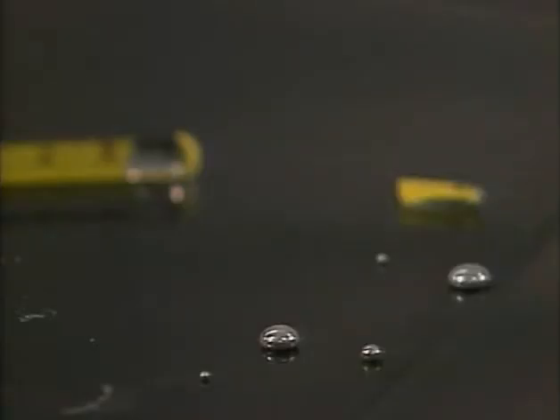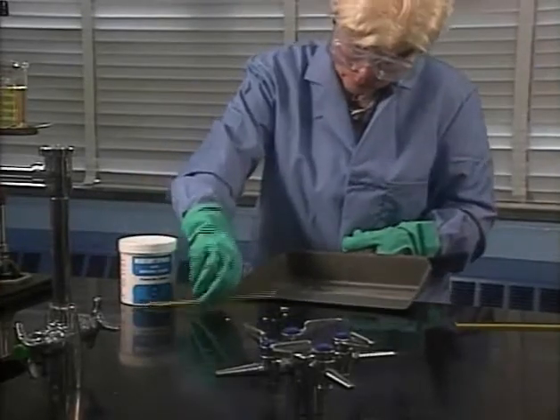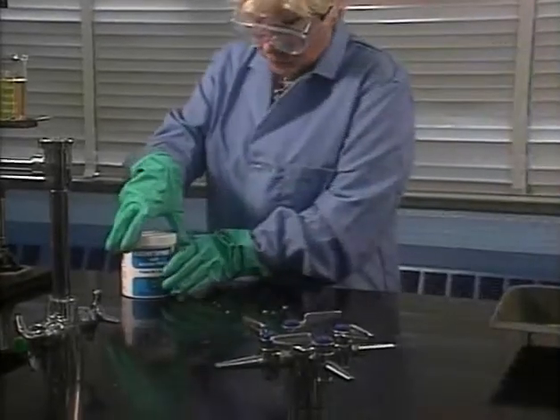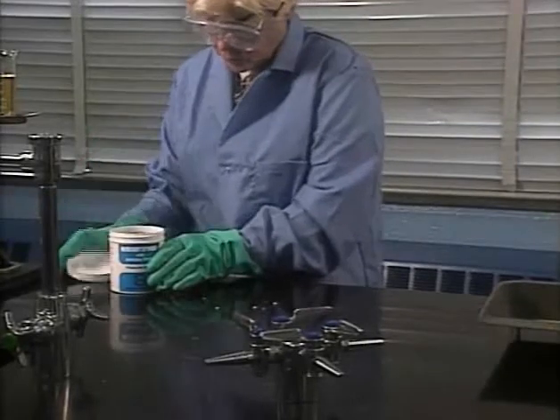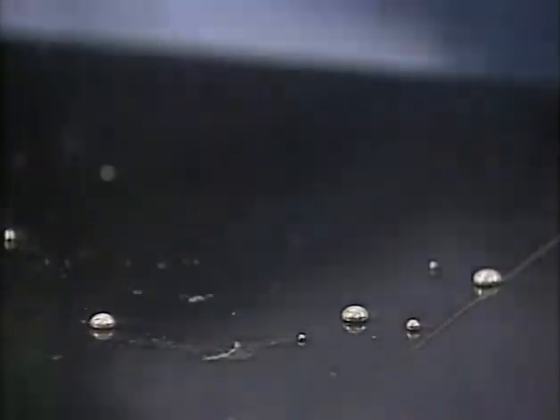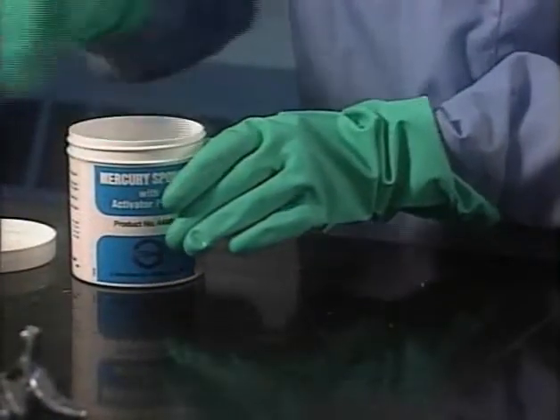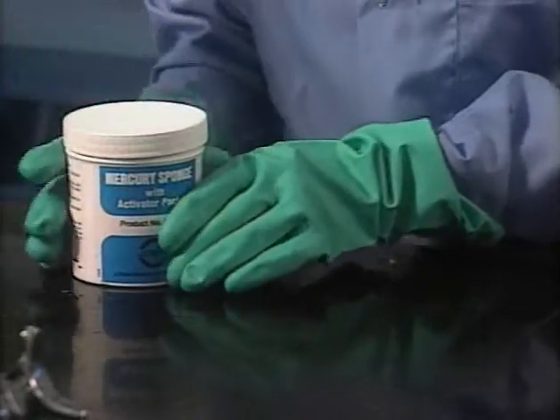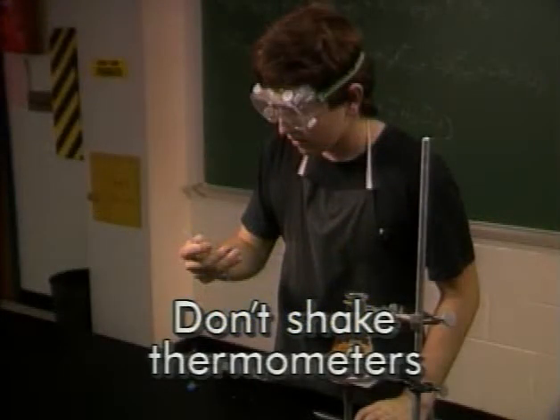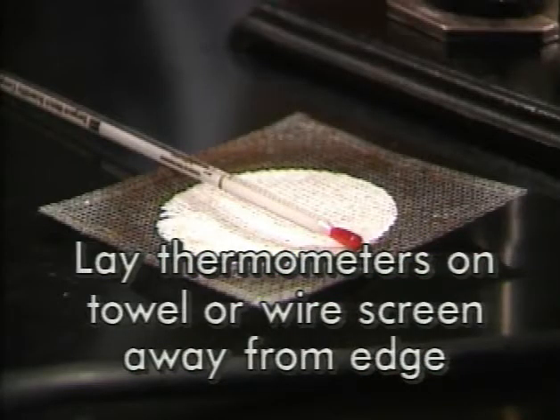Cleaning up a broken mercury thermometer is more difficult and also a job for your teacher. Mercury is poisonous and it won't soak into a paper towel; mercury vapors can also escape into the air. If you work with mercury thermometers, your lab may be equipped with a mercury cleanup kit or sponge. The kit and broken glass should be disposed of in the proper container.